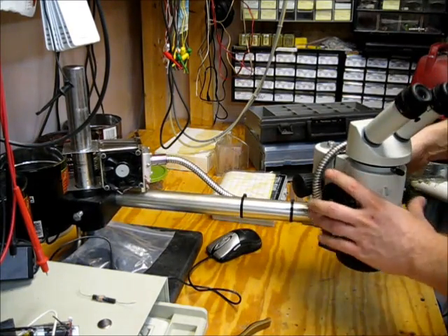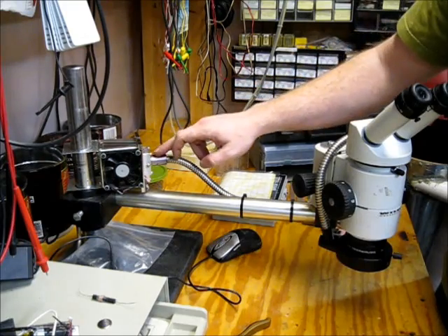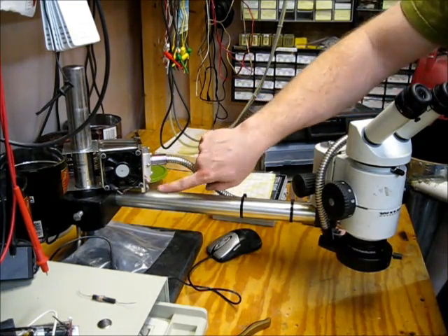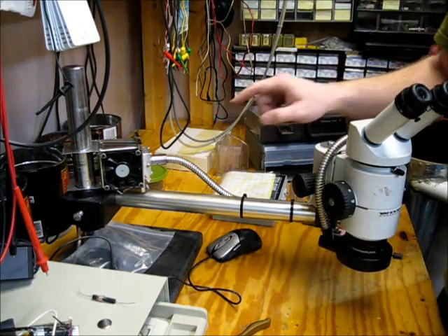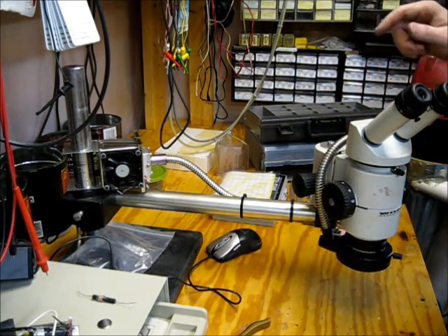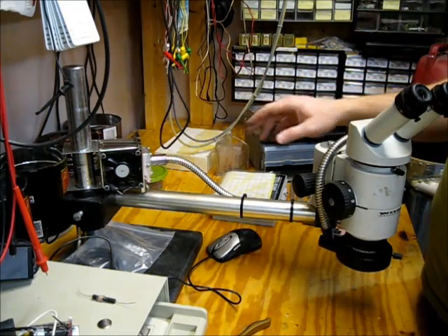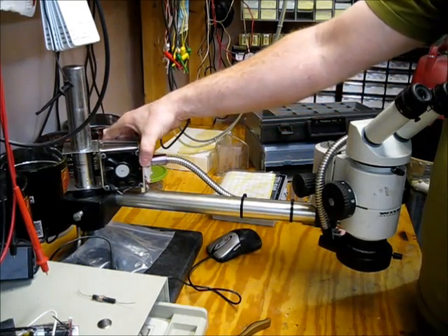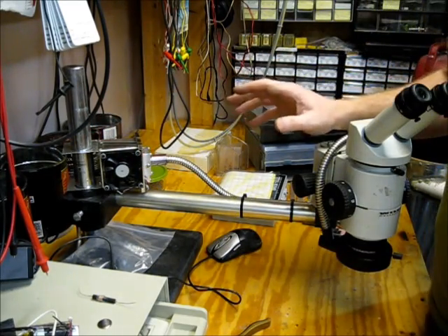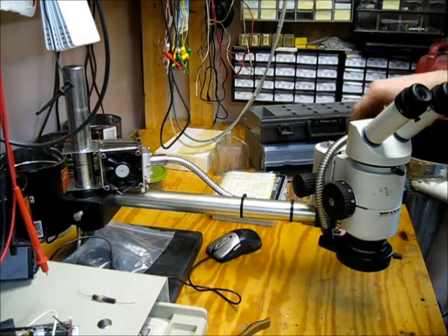Again, for those who just found these videos, behind this custom machined block is a 10-watt LED. This little card here is the LED driver card, and from my previous posts, I thought I didn't need to have a fan on it. Well, after running the light for about a half hour, this heatsink did start getting really warm to the touch. It wasn't burning hot, but it was warmer than I wanted, so I decided to go ahead and add a fan.